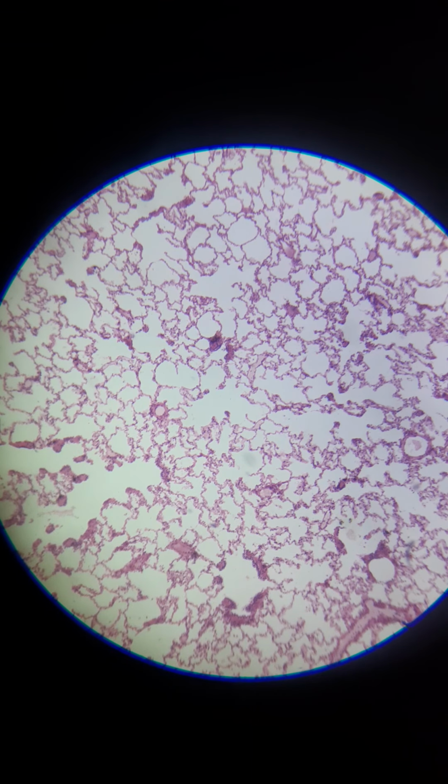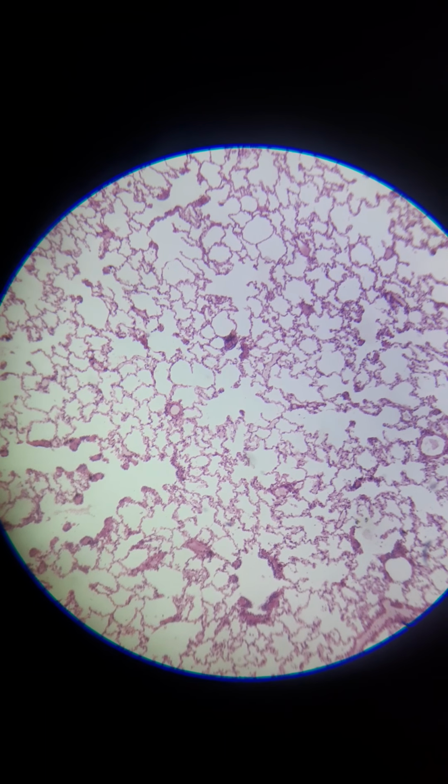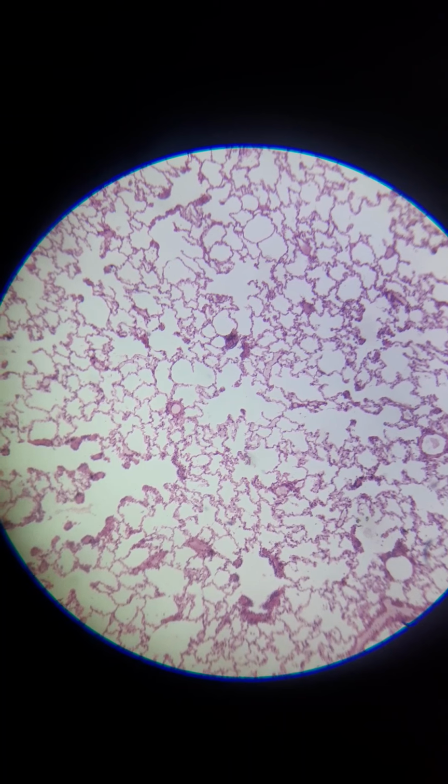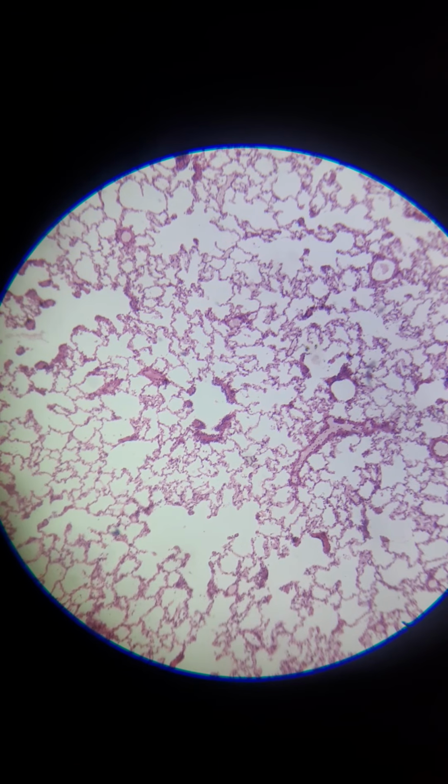So all of these segments that are white in between is actually where the air goes into, and it's called an alveoli. And if you get a big segment of it, it's called an alveolar sac. The air goes inside, and the walls of the alveoli, that's actually where the exchange of oxygen and carbon dioxide is happening. Okay, I'm going to zoom in. Actually, let me see if I can find a couple things to show here first.